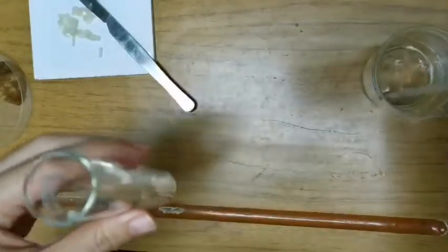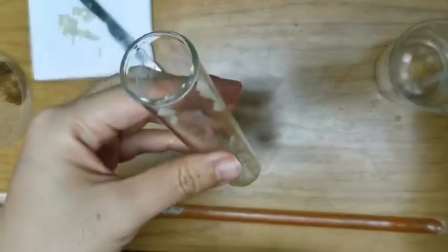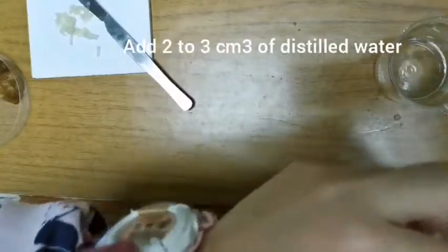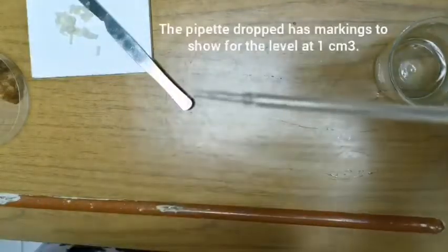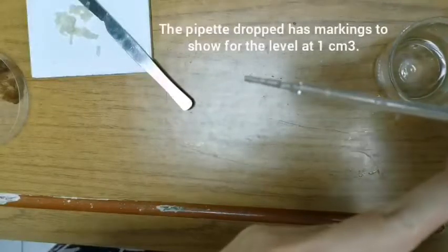And then what I have here is distilled water. You can use tap water as well. So what we want is to add about 2 cm cube of water. Now if you look carefully, you will see that there are markings on your pipette dropper here. Okay, so around here, this is 1 cm cube.